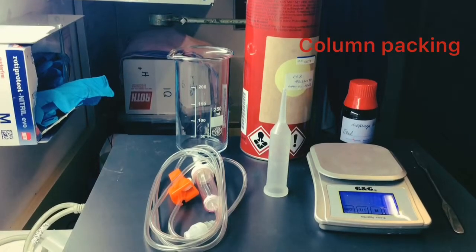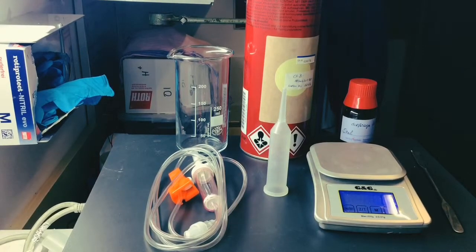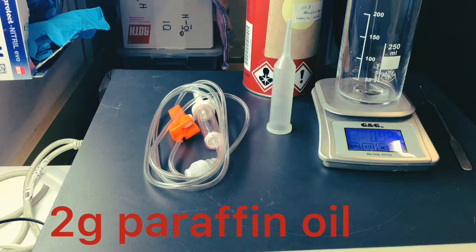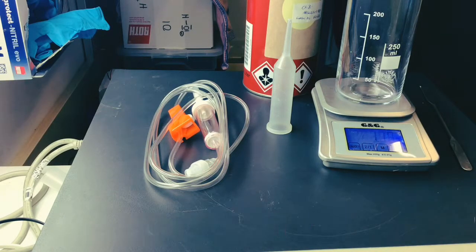Hello, we now explain how to fill the column step by step. First you need 2 grams of high viscosity paraffin oil.